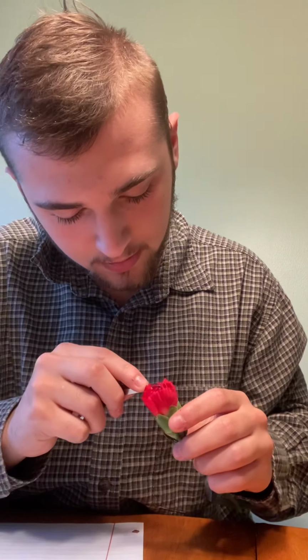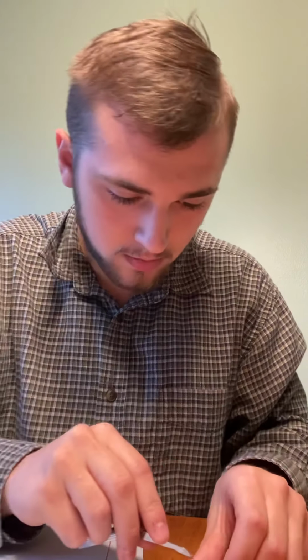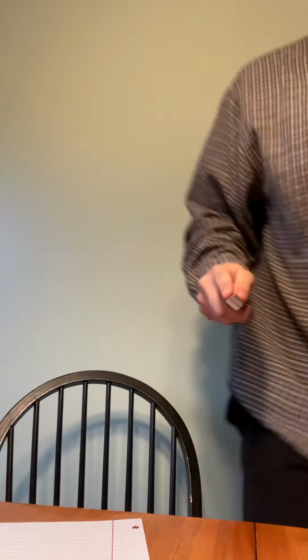And so we're gonna go into here and get into the anther. I'm gonna grab another knife. So let's cut into this.